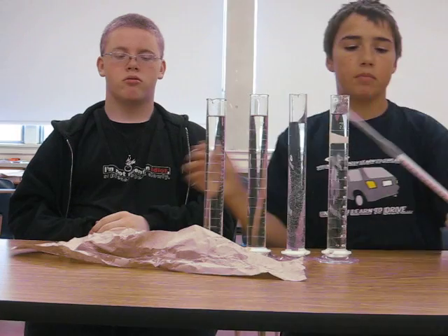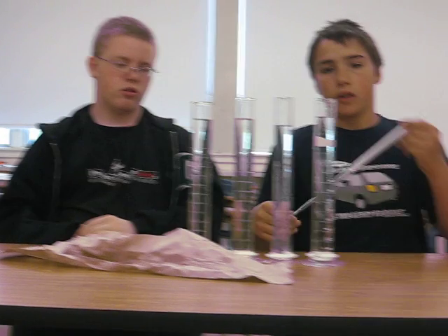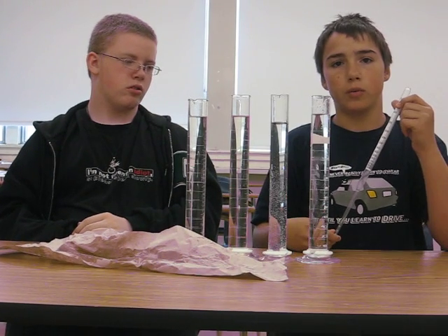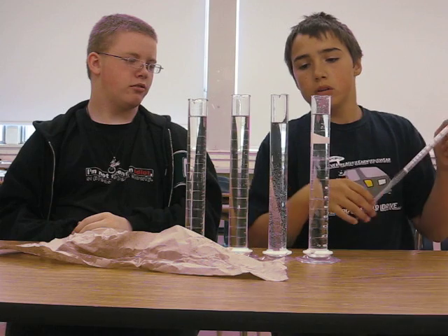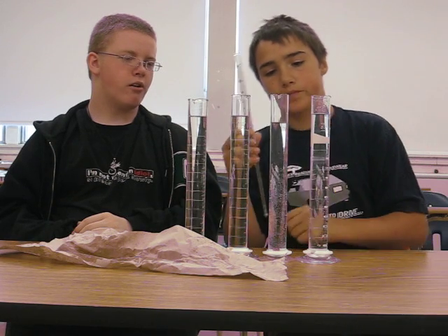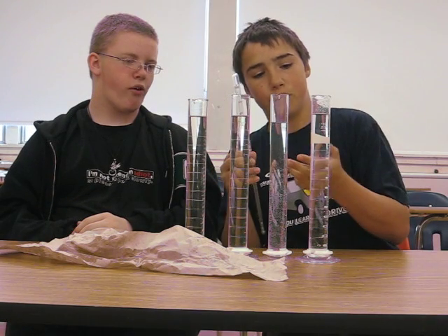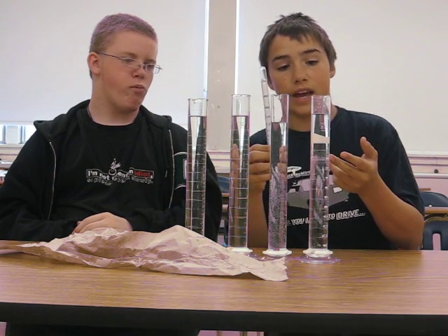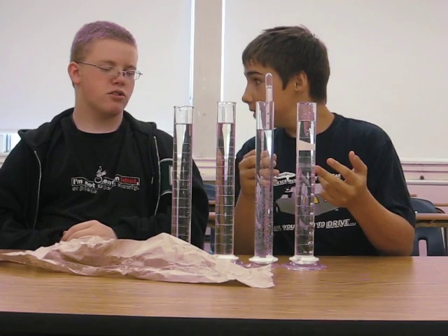Hi, welcome back to Ross's Corner with Eric and Justin. Now we're going to teach you both the density of water and glycerol.